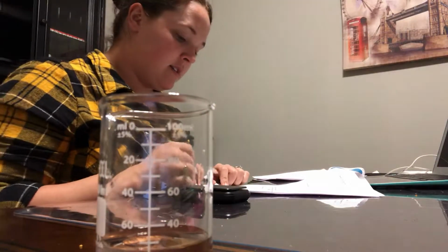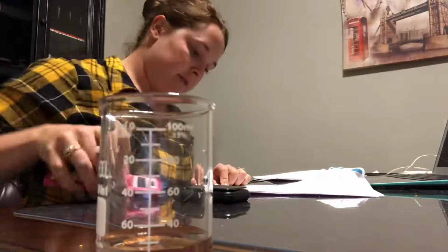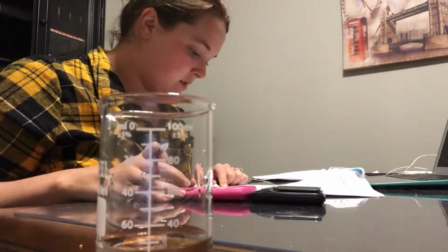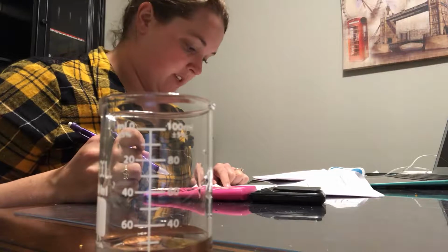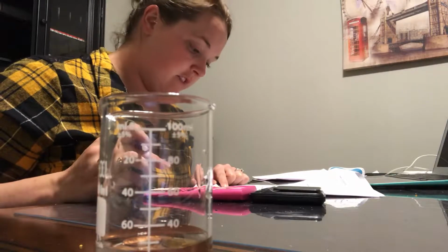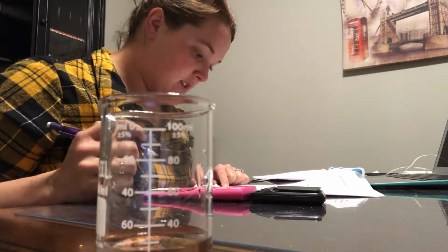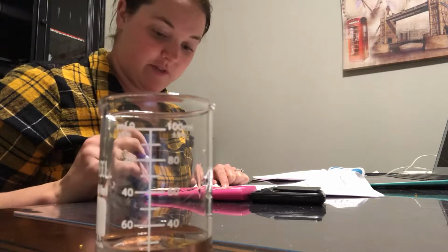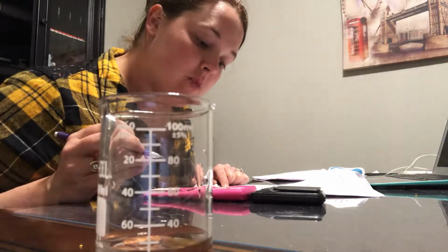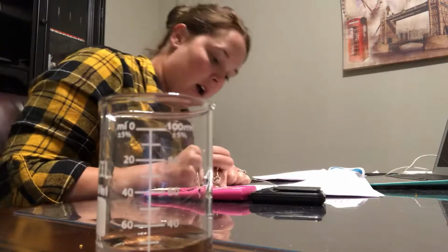Now, C1 divided by D1. C1 is 26.24 because that is B1 plus the next 5 pennies, divided by 26, which is the volume of water after adding 5 pennies. And it's 1.009.